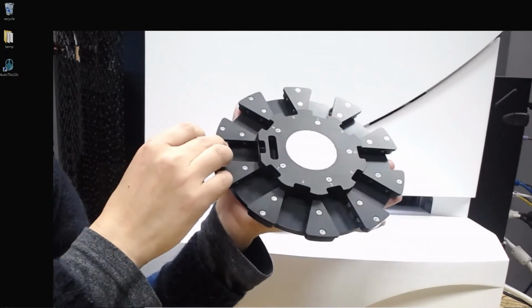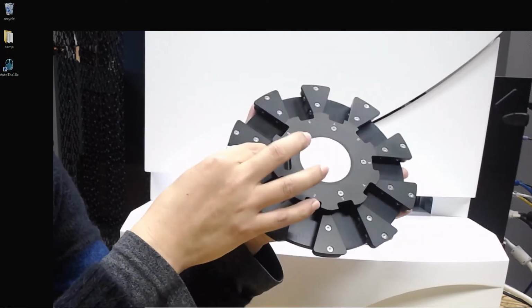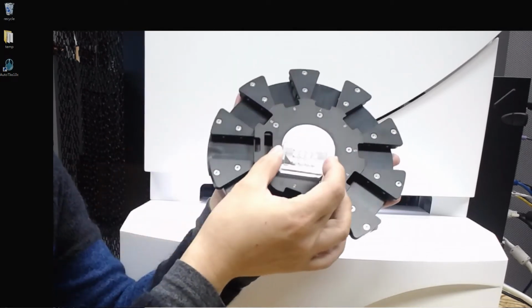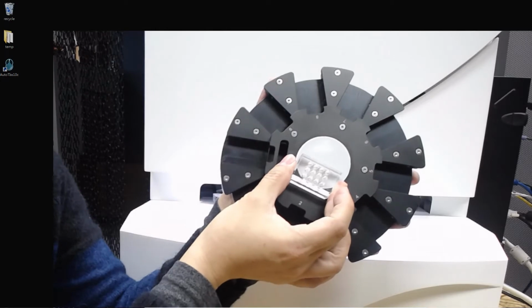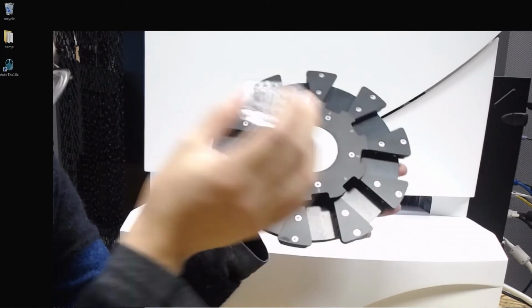And here I'm going to insert the recipient block, doing that. And then we can also use our special PCR block. PCR blocks can take the tissues from the donor blocks, and then you can use it for the PCR.